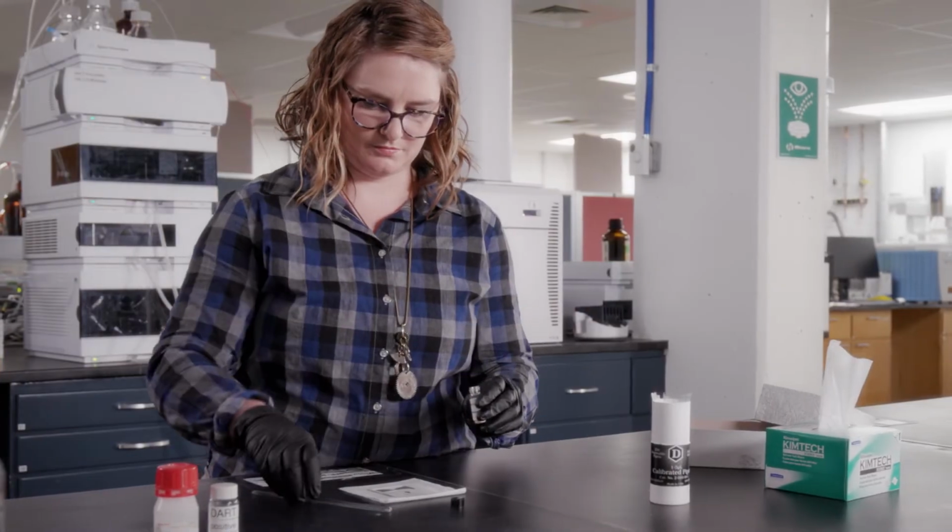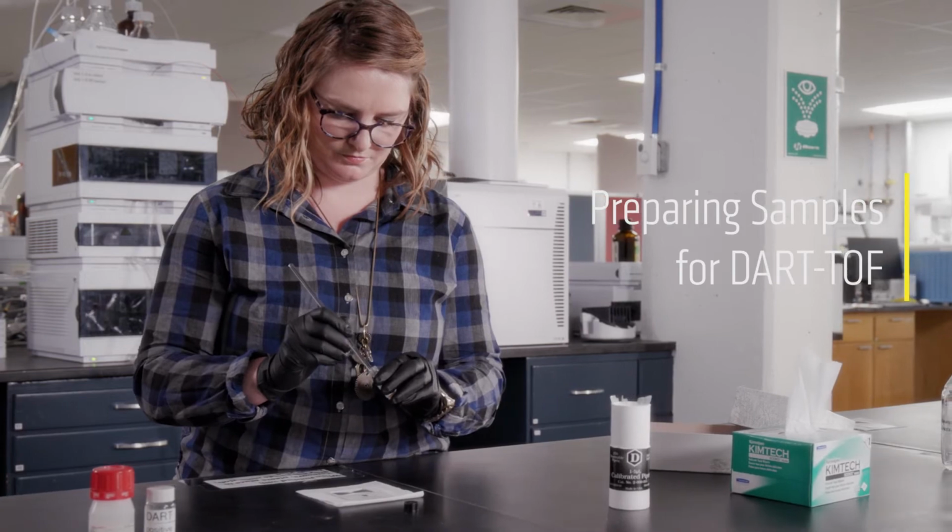In this video, you will learn how to prepare a sample for and collect data on our Agilent 6230 time-of-flight mass spectrometer system using direct analysis in real time, or DART, as the ionization method. One of the biggest advantages of DART is its minimal sample prep requirements.